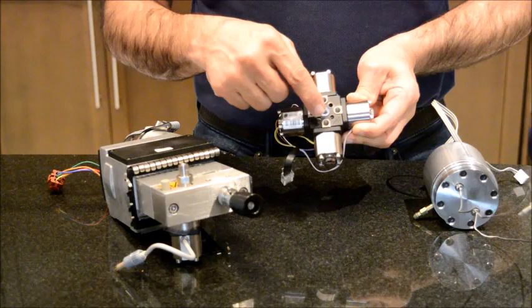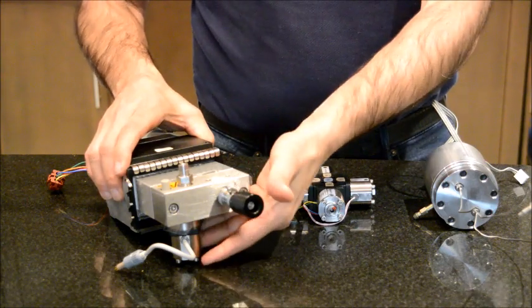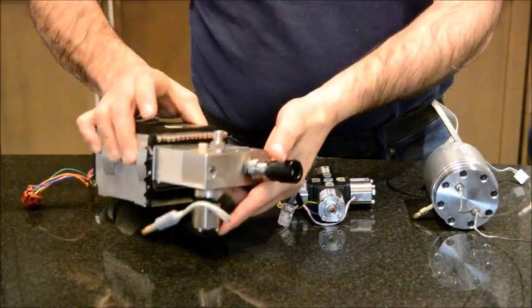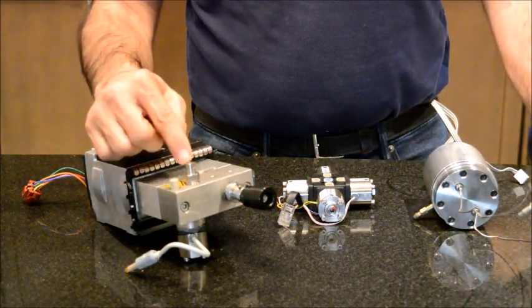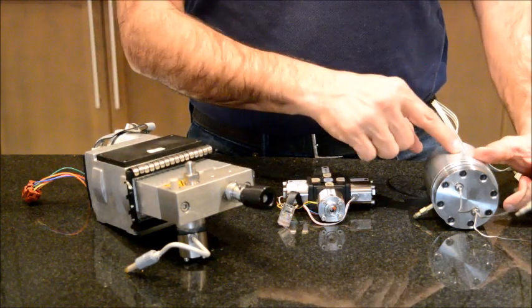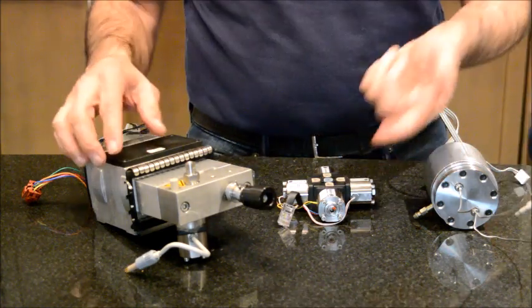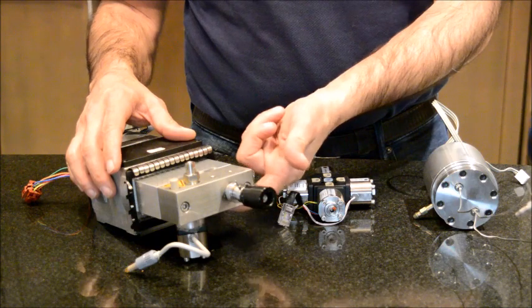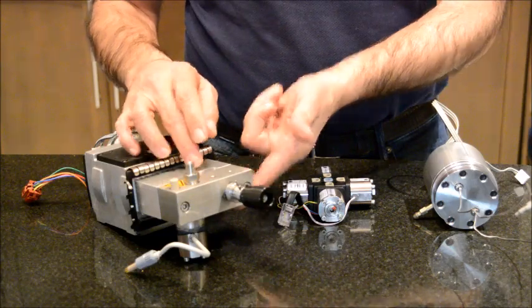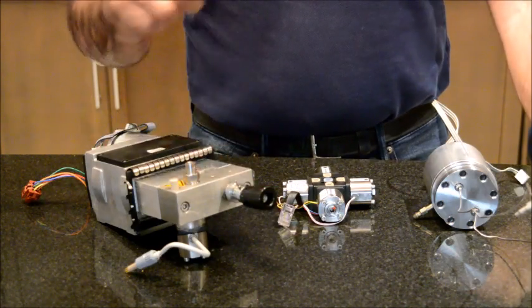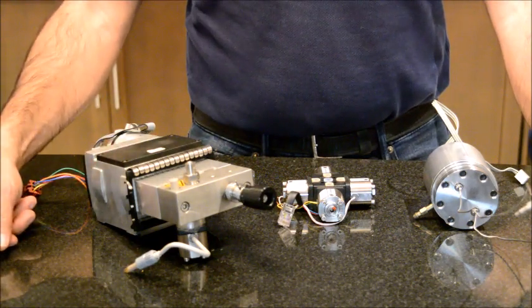From the gradient proportion valve, it will go into the inlet valve at the bottom of the pump. From the inlet valve, the pump pushes it out to the outlet valve, and from the outlet it will go to the flow damper. Then the flow from the flow damper is drawn back into the pump and goes into the bottom of the pump head. From the pump head, the second piston pushes the mobile phase through the purge valve into the equipment, and it will go to the auto sampler, to the column compartment, to the detector, to the waste, and so on.